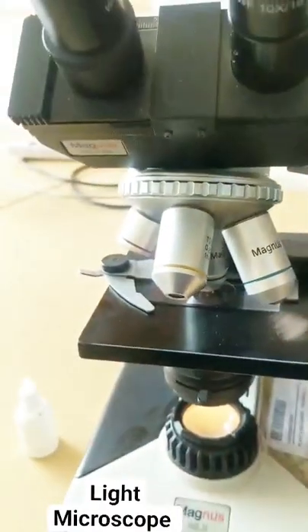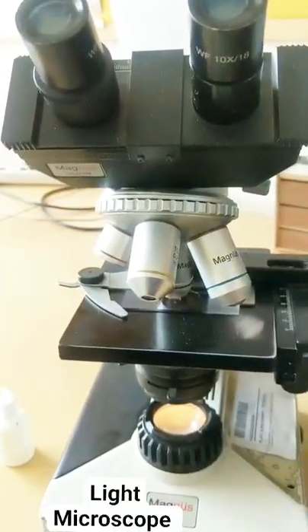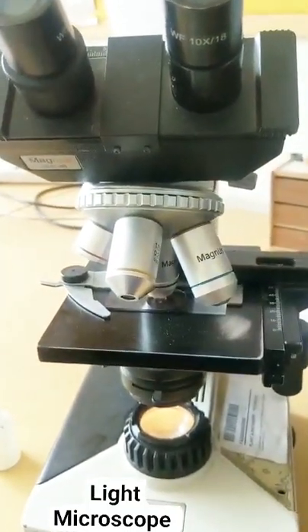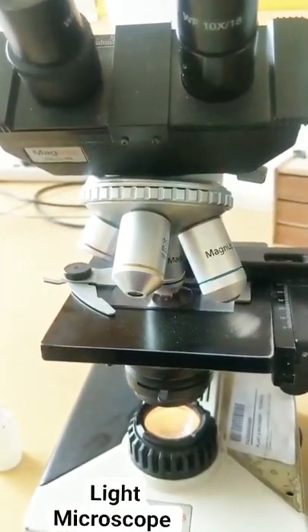So these were the parts of a light microscope that you have to know, which is very, very important for your exam.